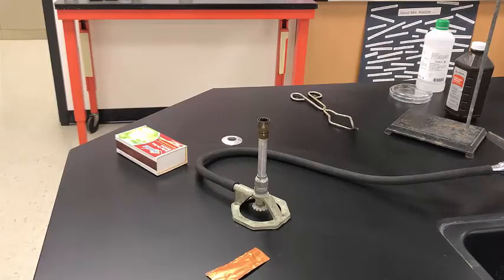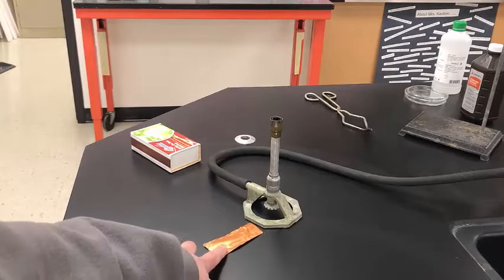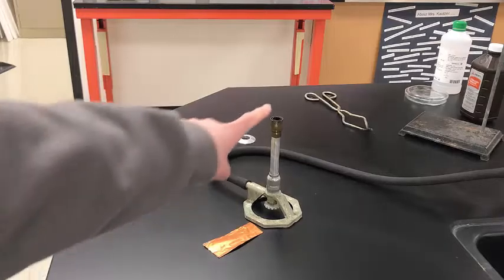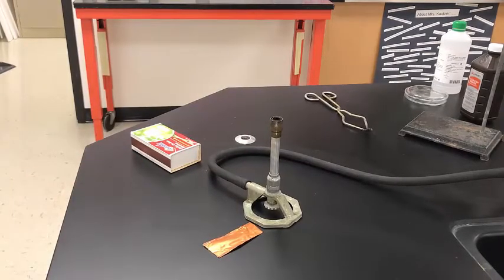Okay, for our next lab, we are going to be looking at the reaction of copper metal with air. So I have here a piece of copper sheet. And the Bunsen burner is going to give us just kind of another kickstart to get the reaction going. The copper is going to react with air. Now think about the element in air that the metal is going to react with. My hint on your sheet there is that sometimes when metals react with air, it's called oxidizing, because think of what element that is that it's reacting with.